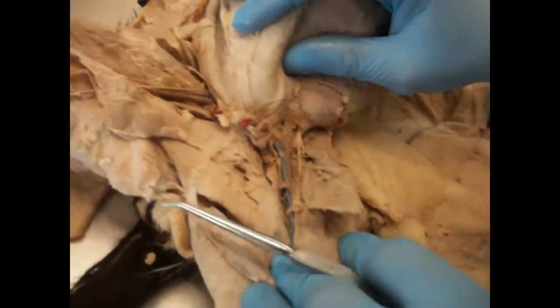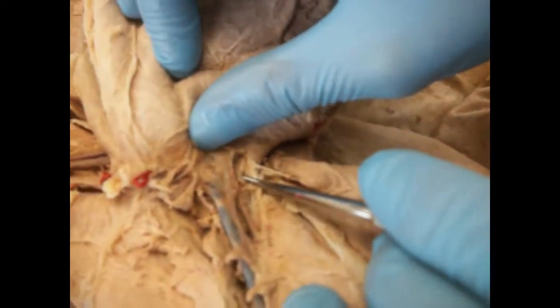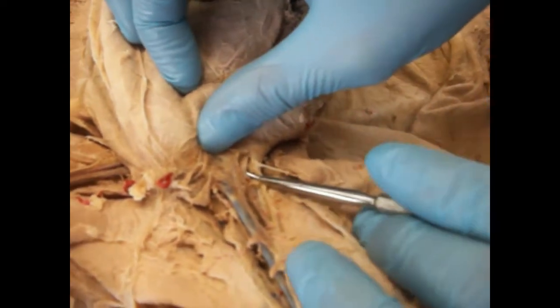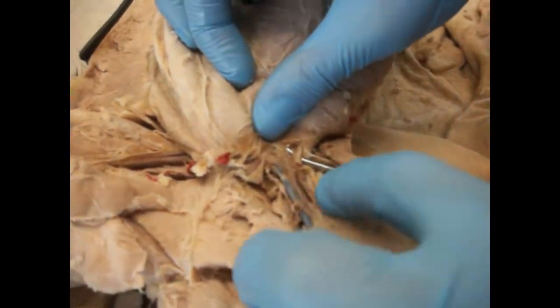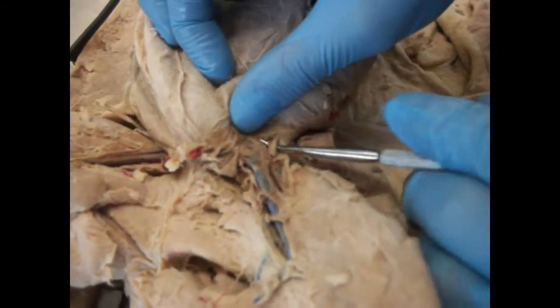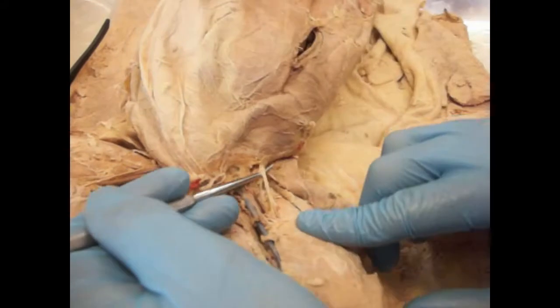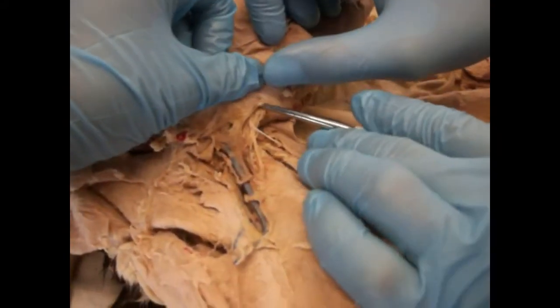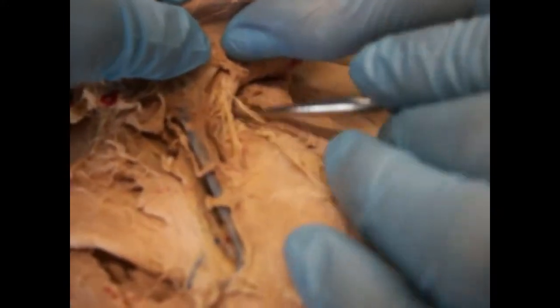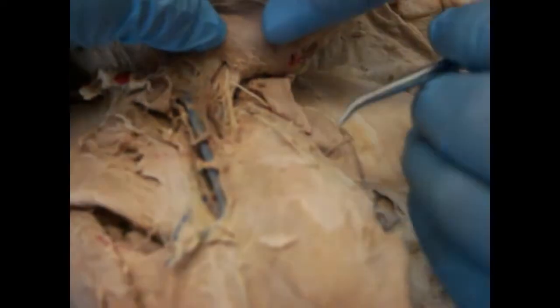Now let's look at the anterior view of the cat. Here, we can see the branches of the nerves, and this right here is actually the femoral nerve again, anterior view. The femoral nerve can be viewed anterior and posterior, and it originates as 1 but branches as 3 in the anterior view. Let's see if you can see this right here. Here is actually one of the branches, as you can see, and if we travel further up the cat, the ventral cavity inside, you can see it originates as 1 and then branches as 3.